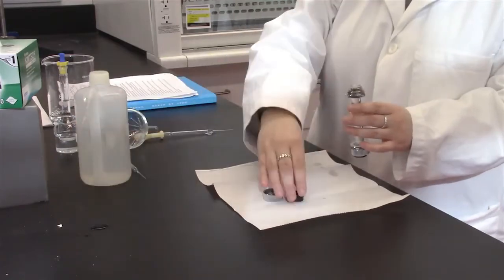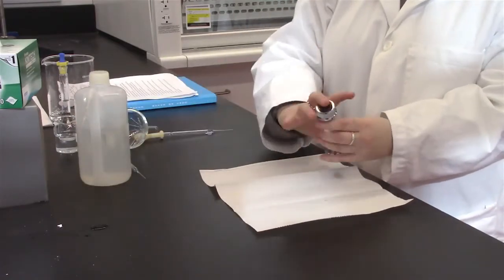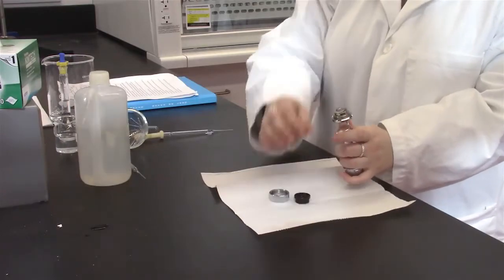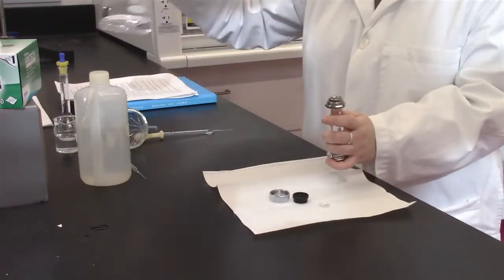Rinse the sample holder with deionized water and then empty into a waste beaker.